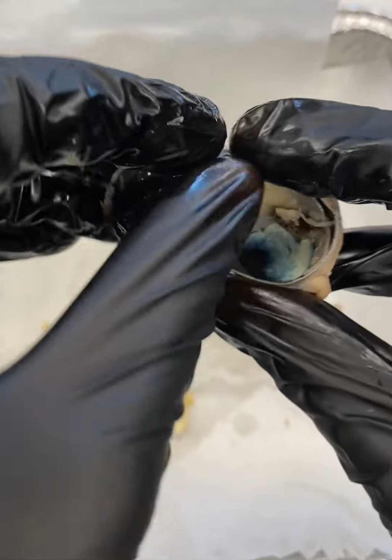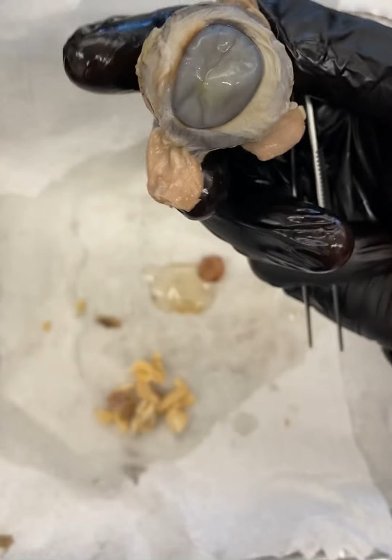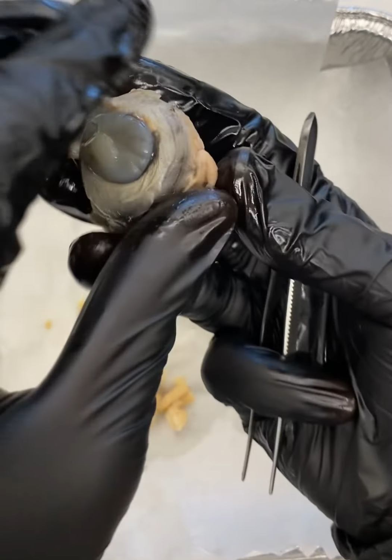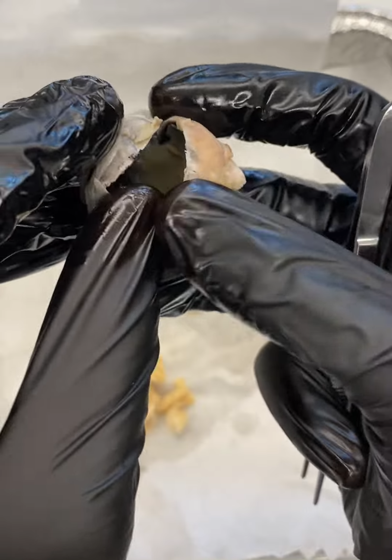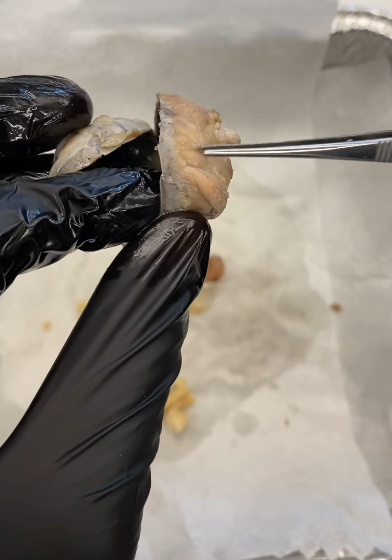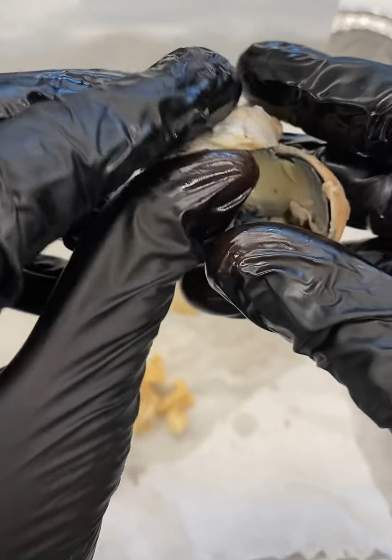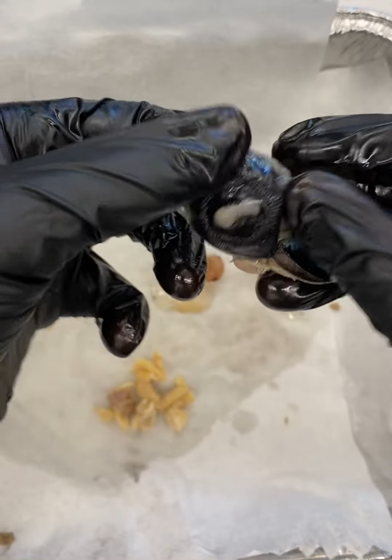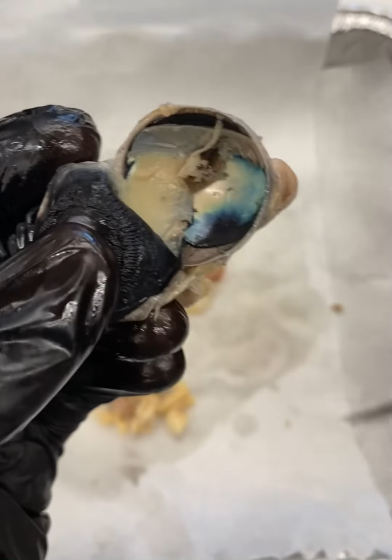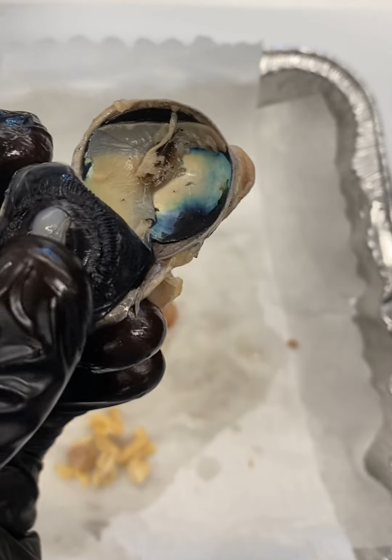So again, just for orientation here. Okay, let me turn this right side out. So here's the anterior part of the eye. We opened it up, right? So here we're looking at the back side of the eye, so posterior and anterior, okay? This is what we looked at last time. We kind of turned this inside out and looked at this region. So now we're going to focus our attention back here at this posterior margin of the eye.